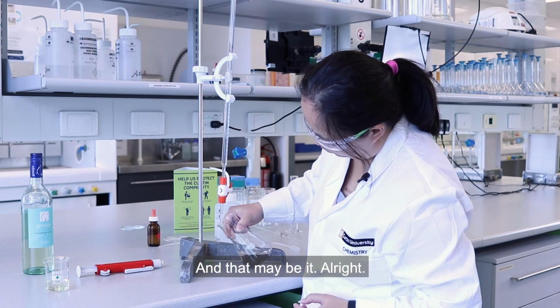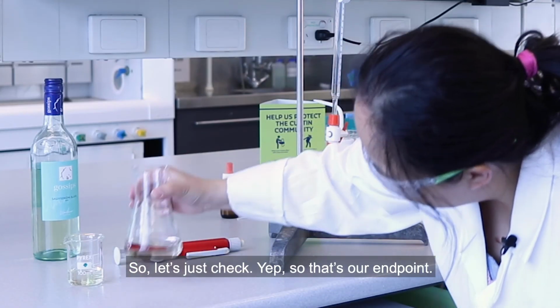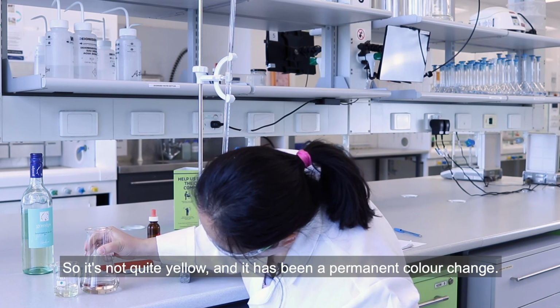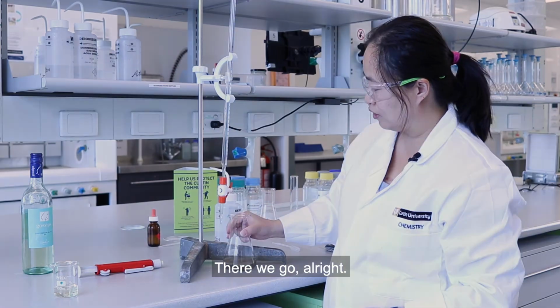All right. So let's just check. Yeah. So that's our endpoint. All right. So it's not quite yellow. Okay. Good. And it has been a permanent color change. There we go. All right.